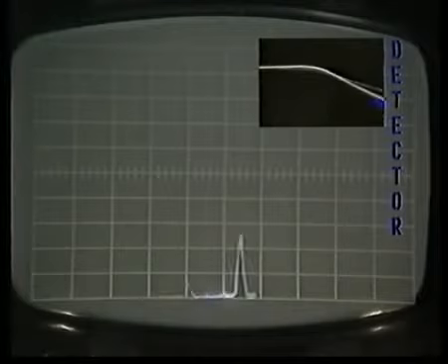Here, a faster scanning rate over a current range of 1.8 to 1.9 amps just picks out the 2 ion beams we saw earlier on. In the graphic display, you can clearly see the movement of the ion beams as they are scanned by the changing magnetic field and move across the position of the detector.